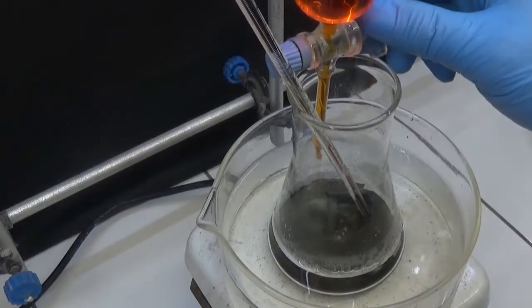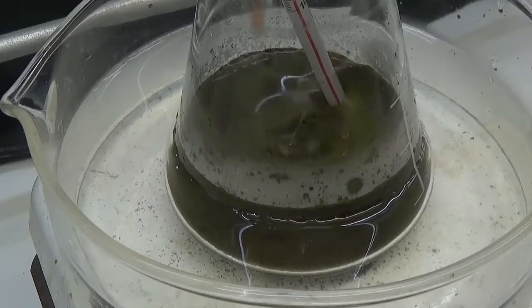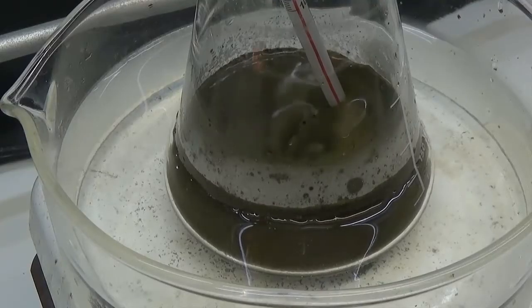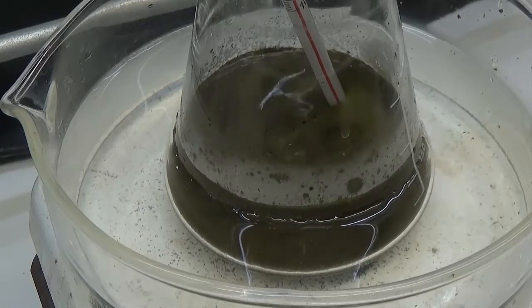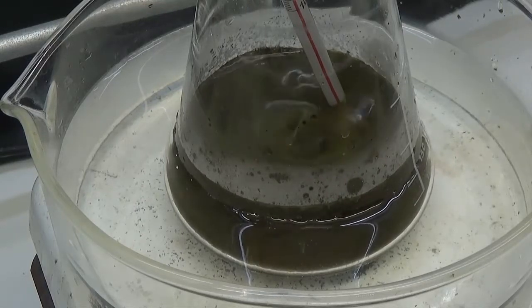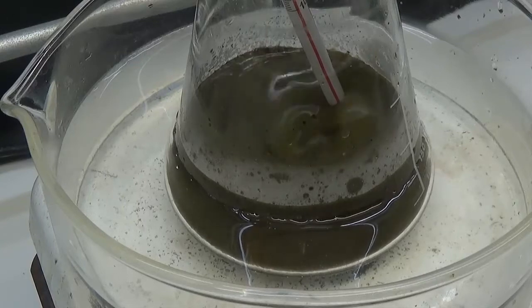In the first stage of oxidation, a green-black precipitate is observed. It is the quinhydrone complex. Once the entire dichromate solution has been added, allow it to stir for an hour.